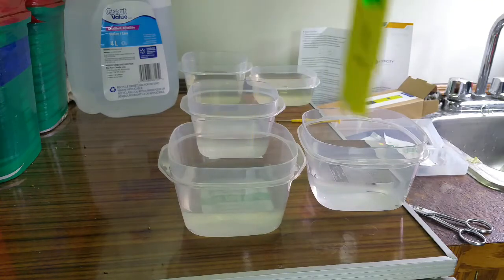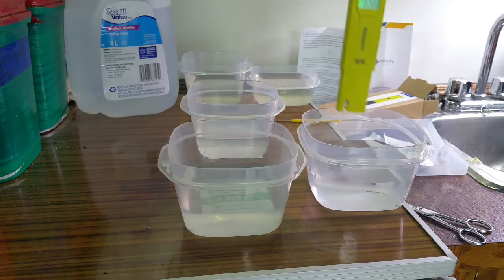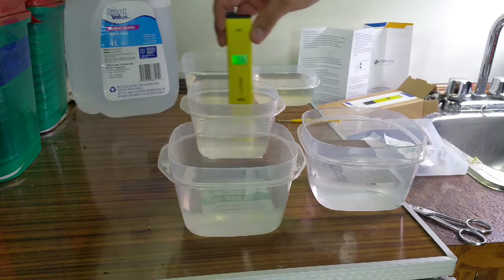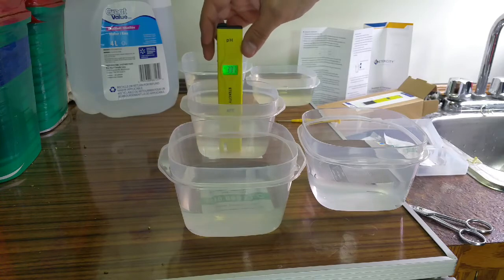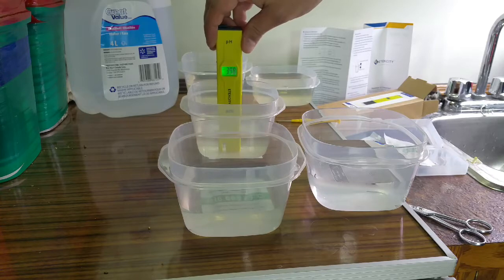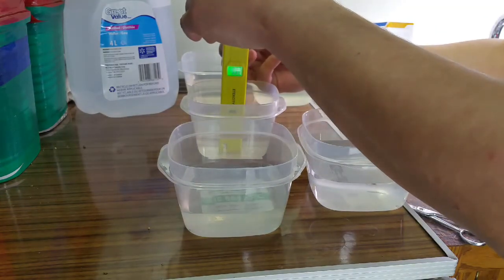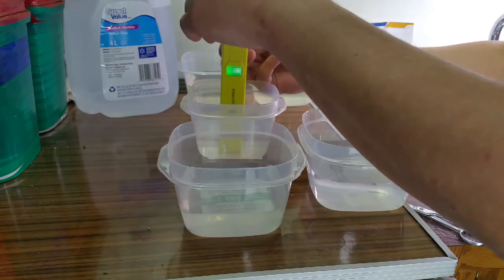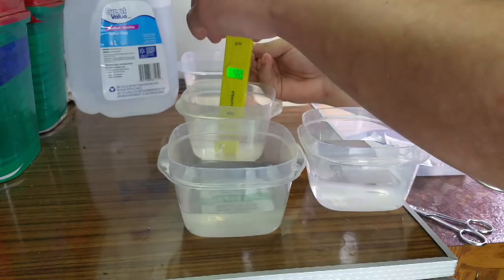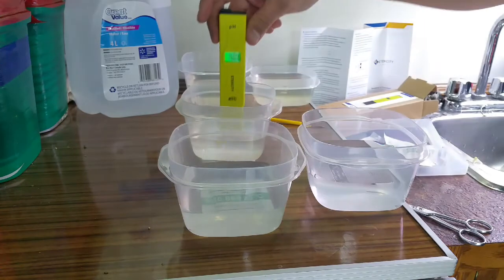Okay, so then between each use I'm supposed to rinse it off in just normal distilled water again. Then I've got a 4.0 buffer powder here. It's pretty close. Let's tweak it a little bit here, a little bit over. Alright, I'm going to go with that.